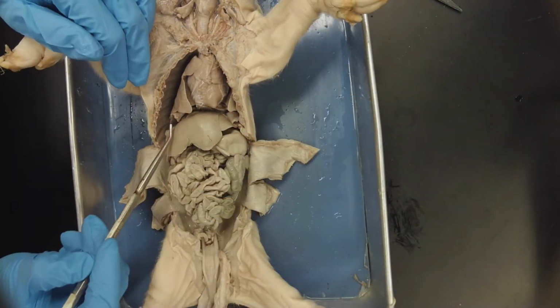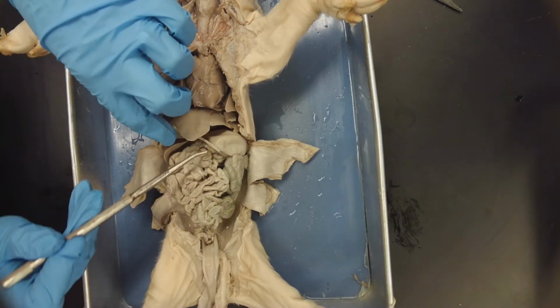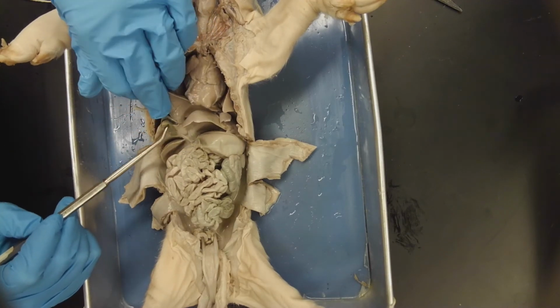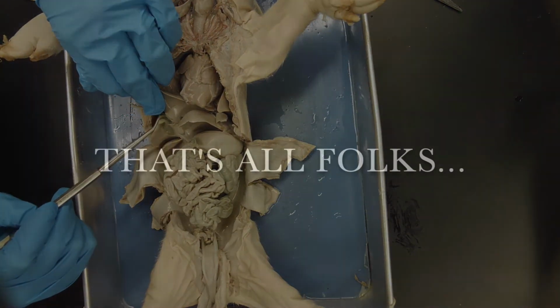We can head back up to the liver, which is nestled right under the diaphragm, lift up some of the right lobes, and see here tucked in the gallbladder. And that concludes our digestive structures of interest.